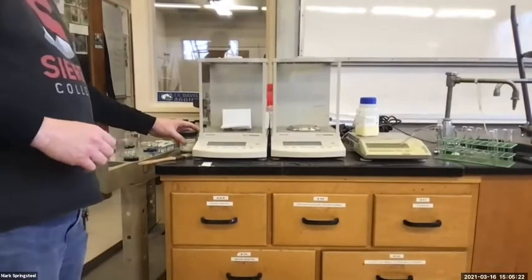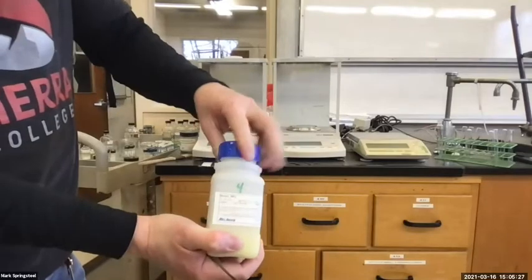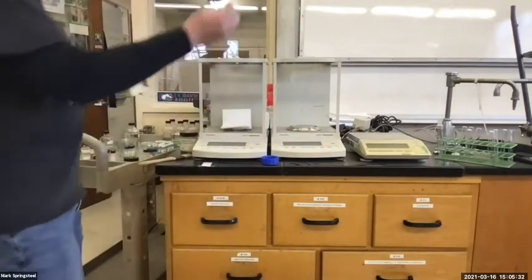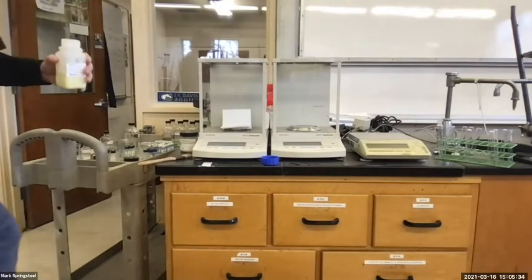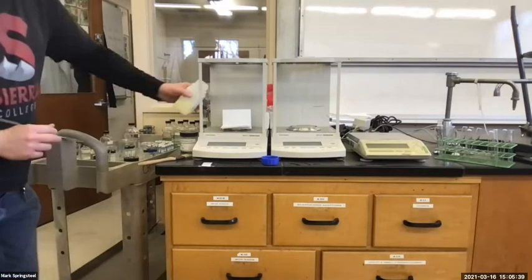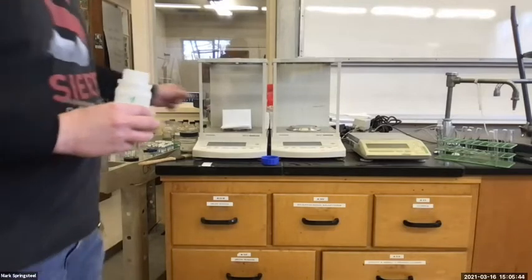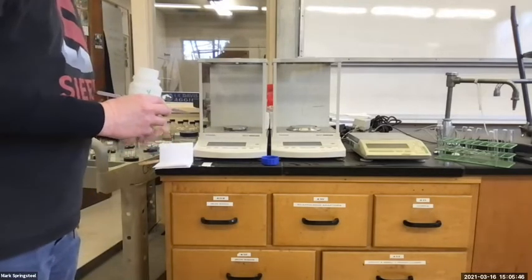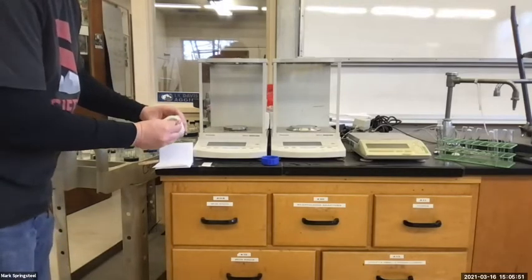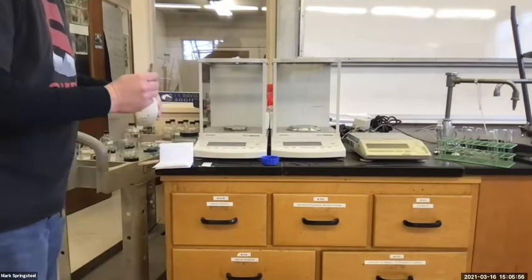So should I add my benzil just straight onto the piece of paper while it's in here? Like maybe through the top, just do a quick 3-pointer? No. What about just from the side, toss some up like that and hope it hits? No. I want to always take whatever I'm putting my material on out of the scale and measure it out of the scale. This way, if I spill a little bit, it's on the counter, super easy to clean up. It's not in the scale.